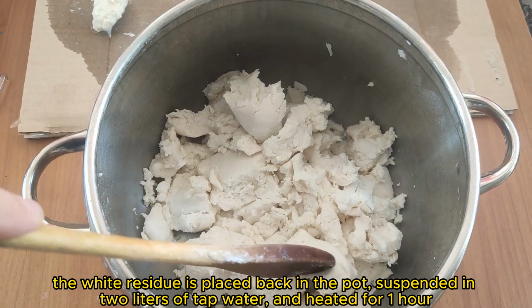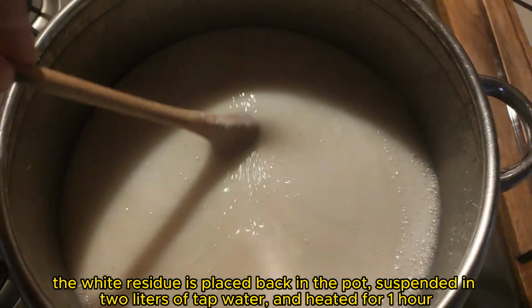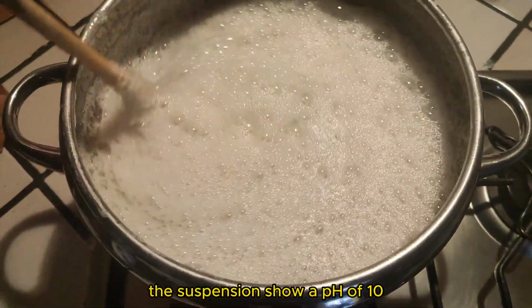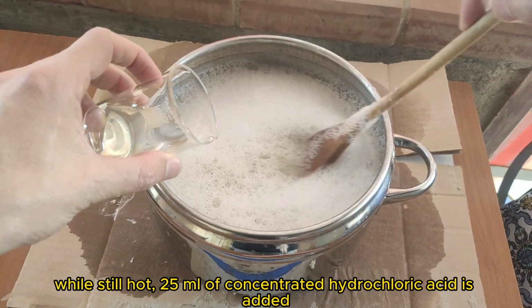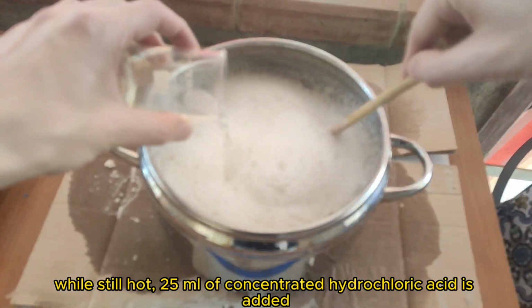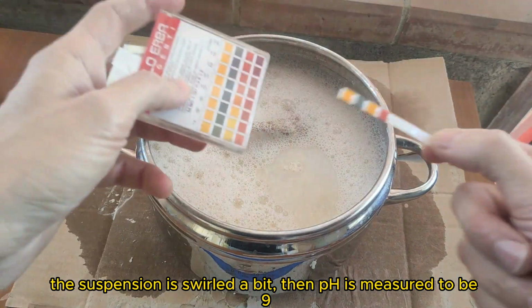The white residue is placed back in the pot, suspended in 2 liters of tap water, and heated for 1 hour. The suspension shows a pH of 10. While still hot, 25 milliliters of concentrated hydrochloric acid is added. The suspension is swirled a bit, then pH is measured to be 9.